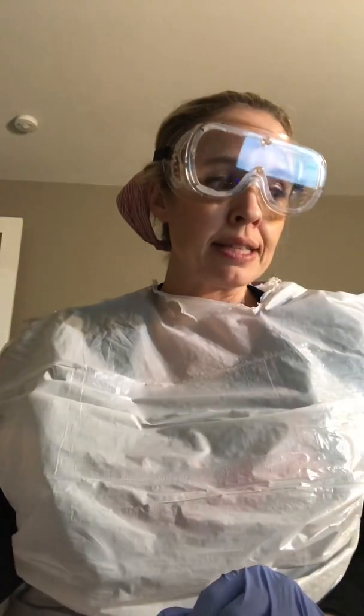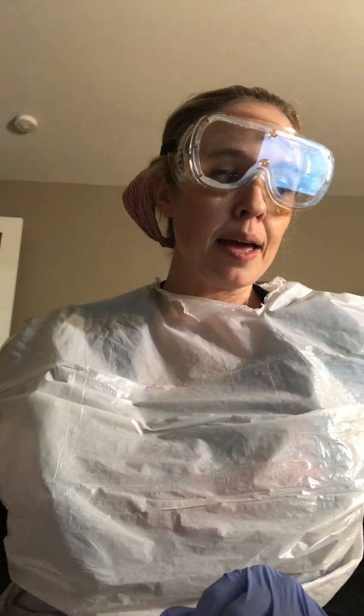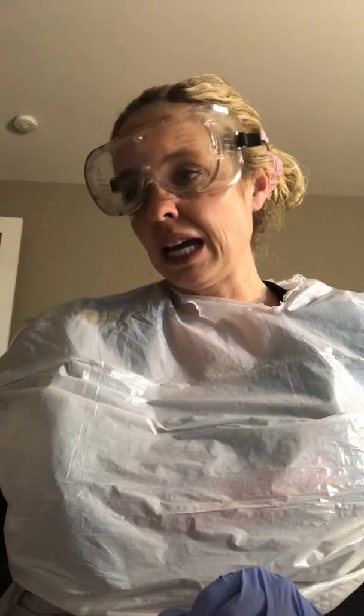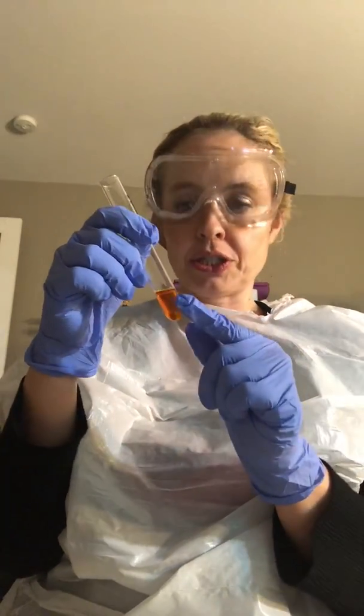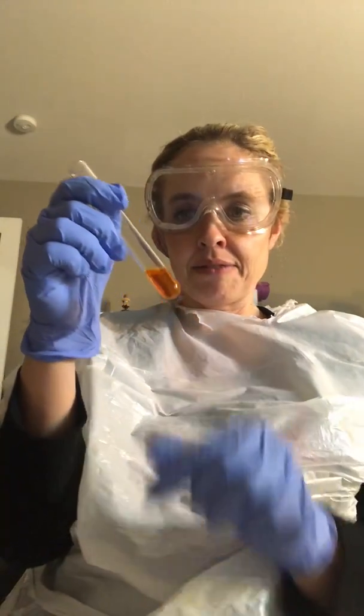And then second, I did the epidermidis. And that one, it was a little bit lighter, more like a light orange. I think I kind of blended it together at this point, but it's in my pictures. It was a little more yellowish orange, but definitely negative in comparison to the other one for the acidic fermentation.